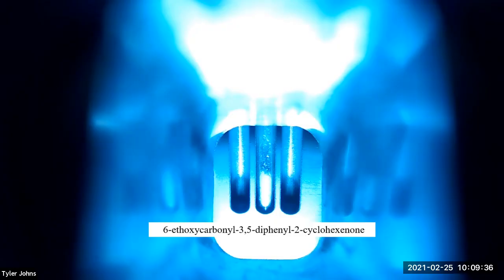We will now perform a melting point determination of the purified product.